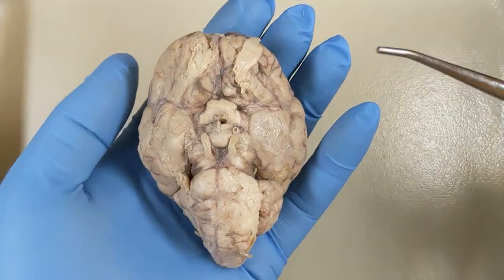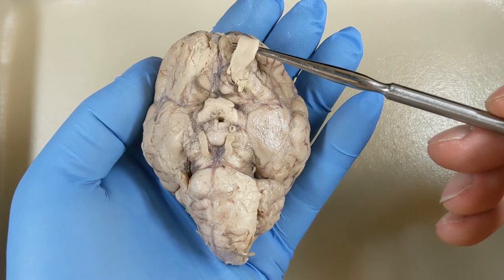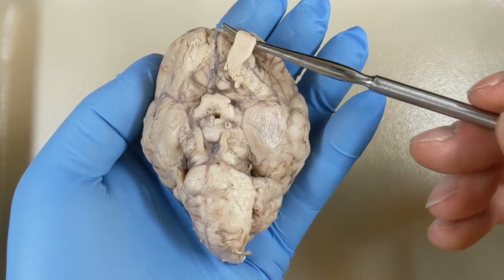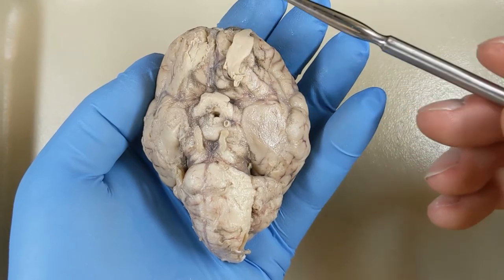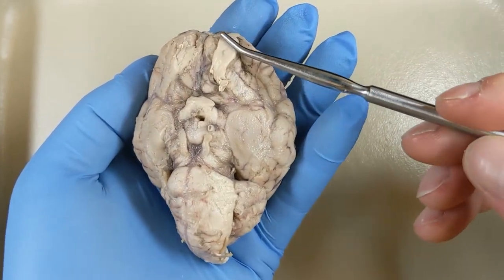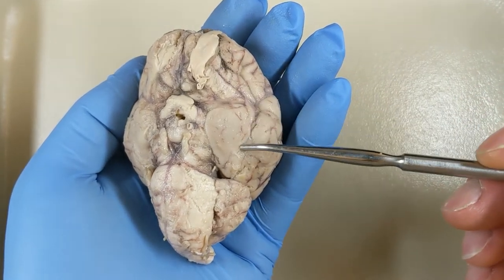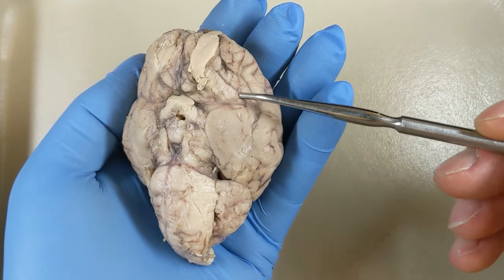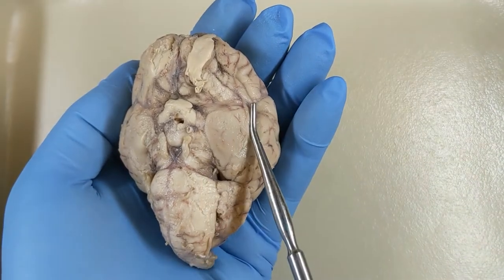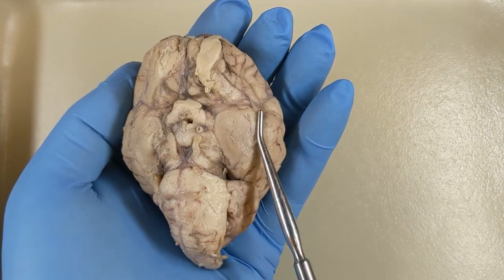Now let's review the ventral view of the sheep brain. Here's the olfactory bulb, which relays smell signals from the olfactory epithelium in your nasal passages to the brain. Roughly where the olfactory bulb meets the brain is the beginning of this sulcus, which continues all the way back — that's the rhinal fissure. All the cortex medial to that is the piriform cortex.